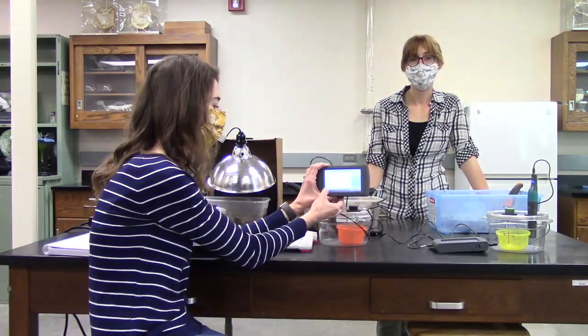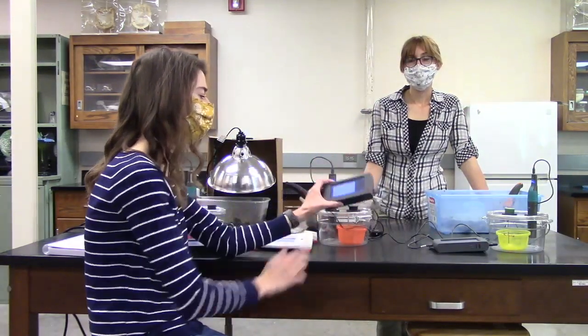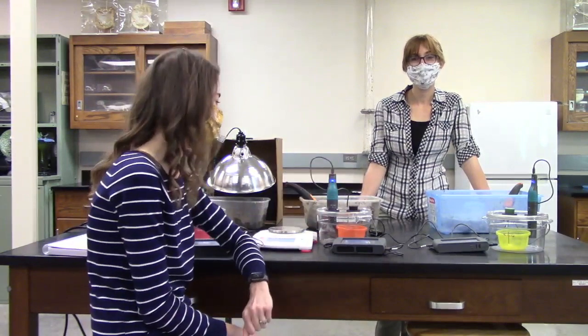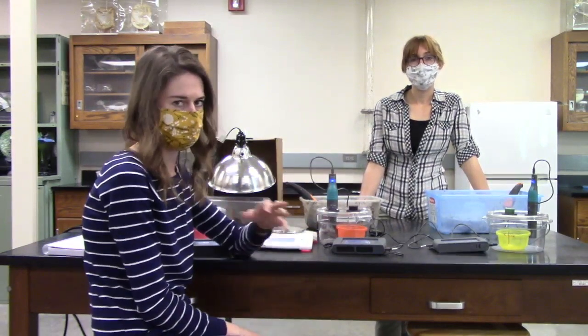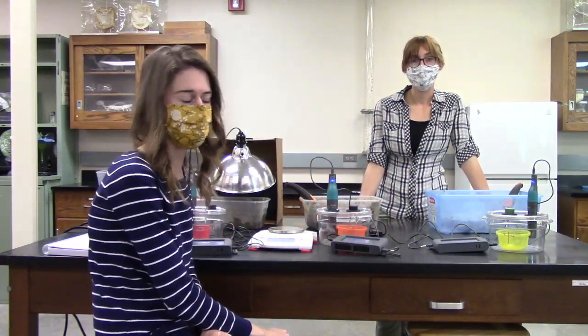So I've been letting that run for a few minutes, and what you should see is some up and down, just because the sensors are not top of the line, and there are going to be some naturally occurring changes. But it should basically be a flat line when you're using that with no soil inside the chamber, because there are supposedly no microorganisms in there putting off any CO2.